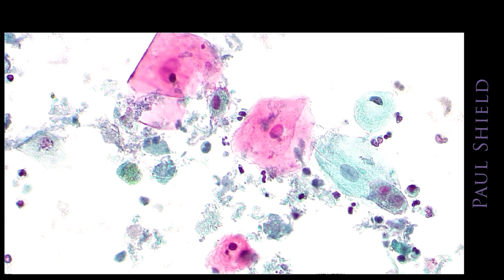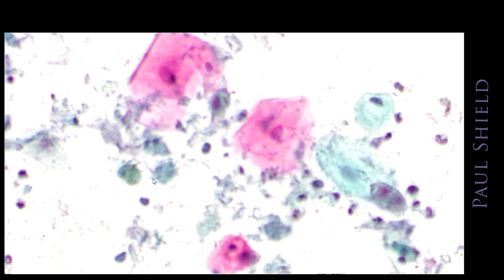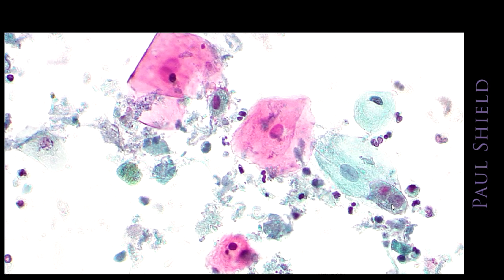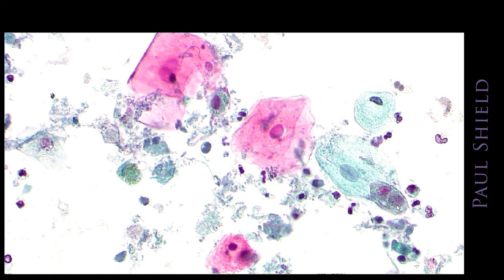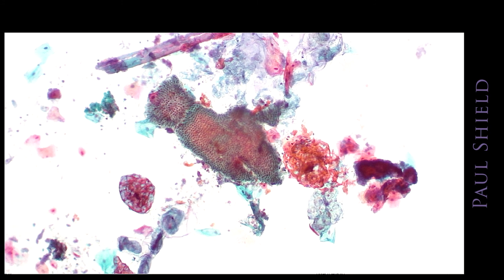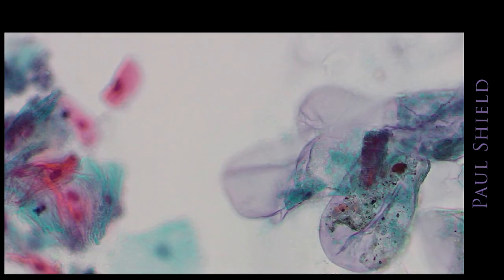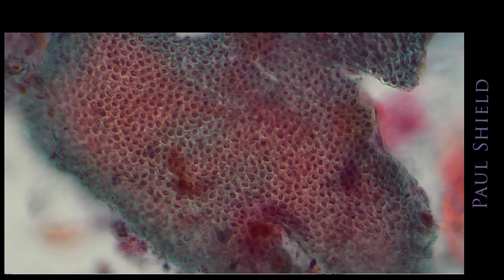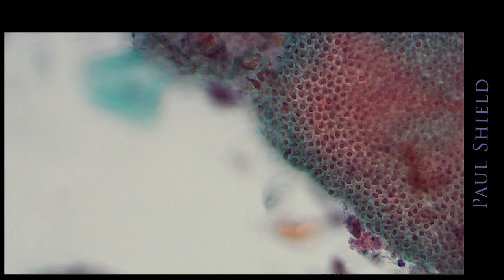They typically have a histiocytic appearance and then pigment in them, as you can see, especially in that lower one. A couple more over there. Also, you see in sputum a lot of junk, really, and this is a whole lot of debris out of the oropharynx. Sometimes all you get is saliva, and it'll sometimes have the patient's breakfast in it. So these are plant cells. This is another big sheet of plant cells, and you can see they have quite thick cellulose walls to them.